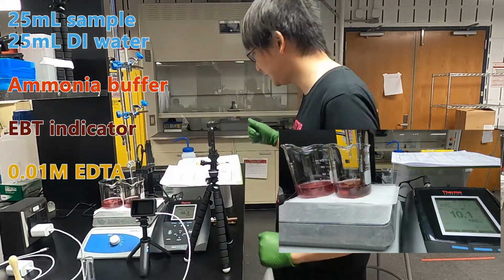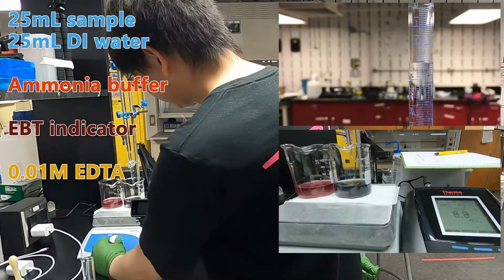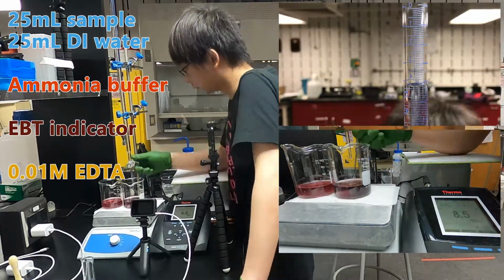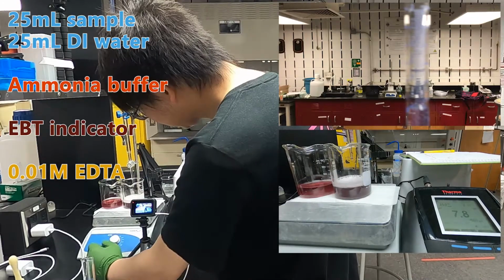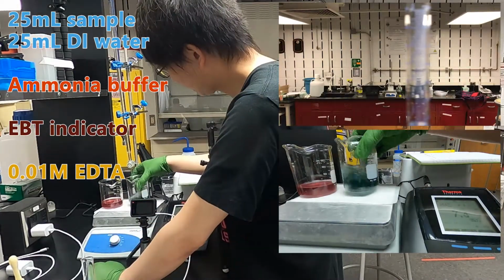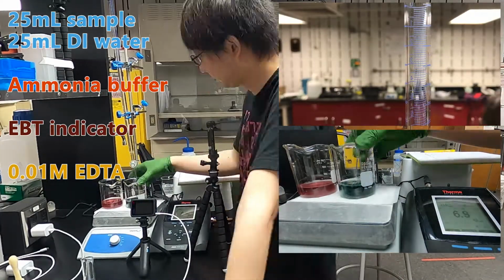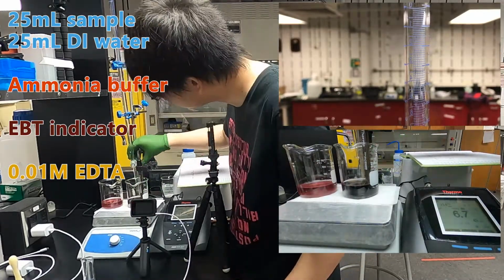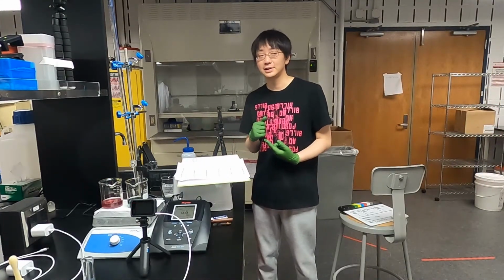Next, we titrate with EDTA. And then by having the volume that makes the color change, we can calculate the total hardness.